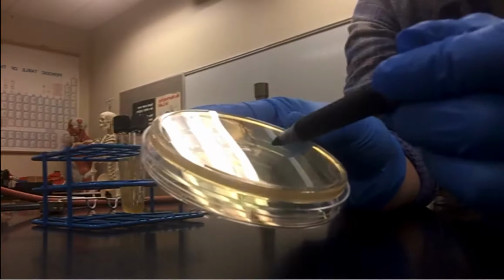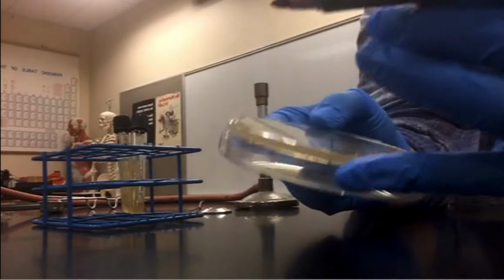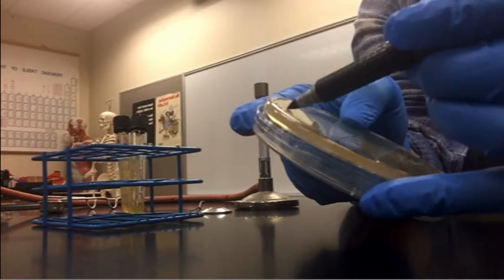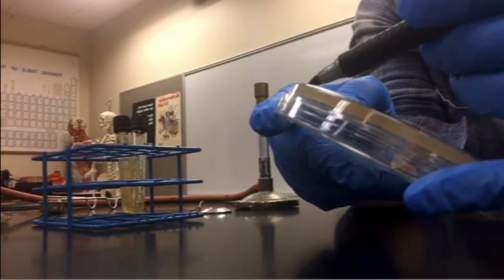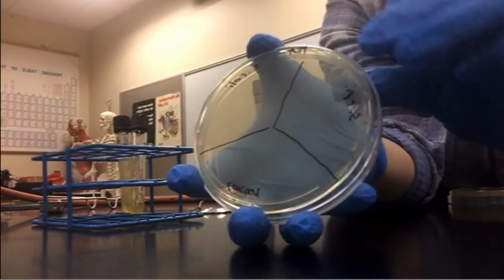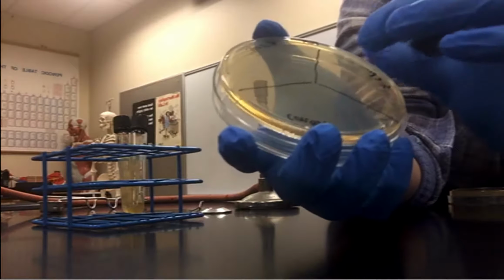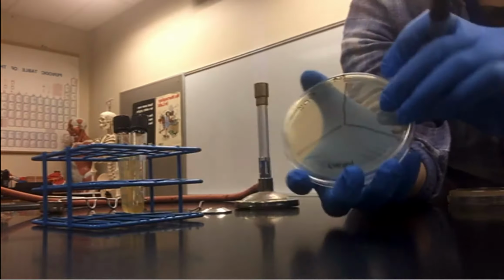Basically make these little trisections, and then I'm going to go ahead and label for each bacteria. So I got E. coli, S. epi, and then the third area I'm not going to inoculate, so that's going to be our control section. And again, it's because you want to compare growth, and it's not going to be presence absence. On this plate, since it's the PEA plate, it promotes gram positive. So again, we should see more growth in the S. epi than in the E. coli, and certainly the control.